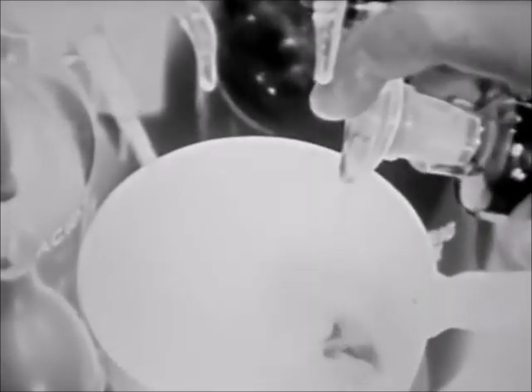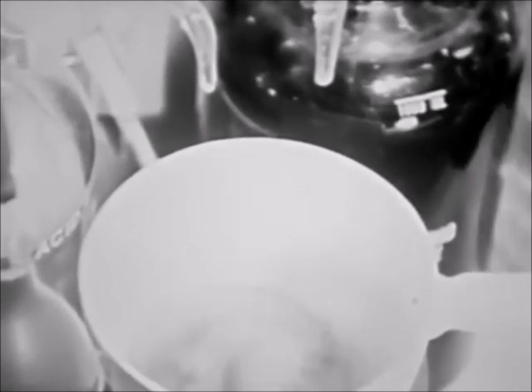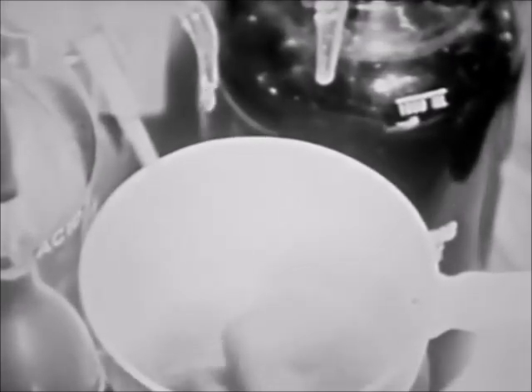Add five drops of the chloride indicator. The sample will change to a blue, violet, or deep red color. Now add the nitric acid carefully as you stir the contents. Continue this process until the blue, violet, or deep red color changes to yellow. Then add exactly one milliliter of nitric acid to obtain the proper acidity.